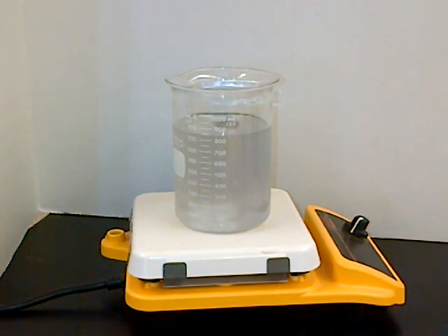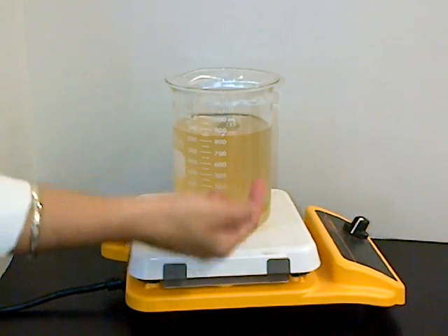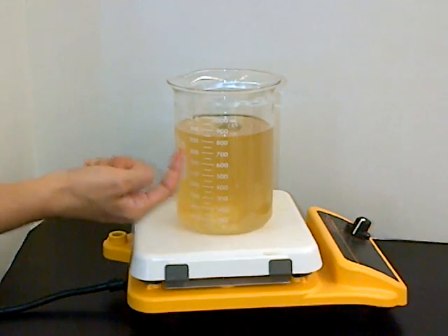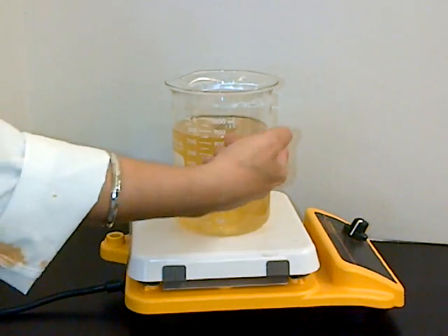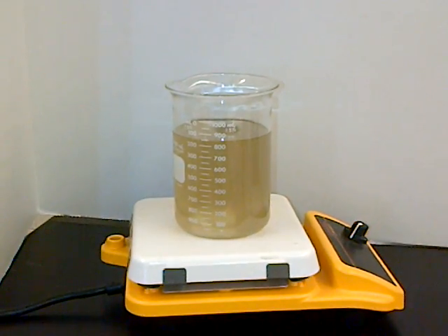Now you can see the gas that's coming off of it. It's all bubbling up on the sides. That's the oxygen gas that's coming off.